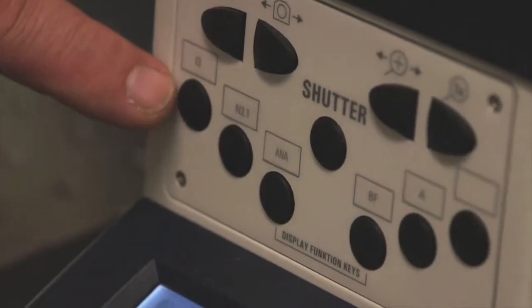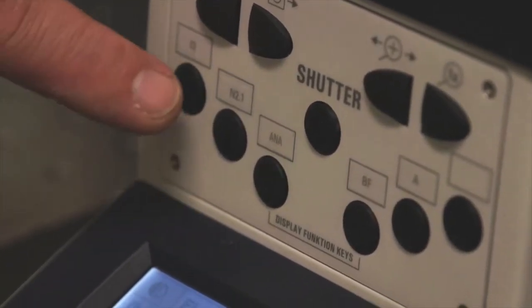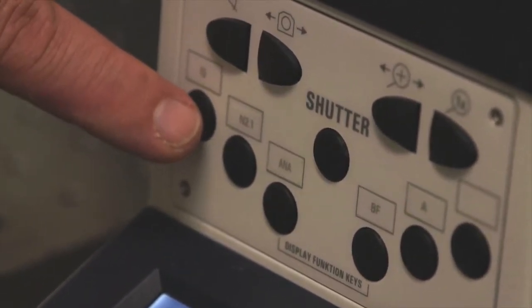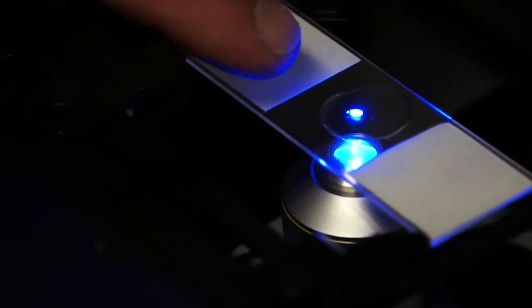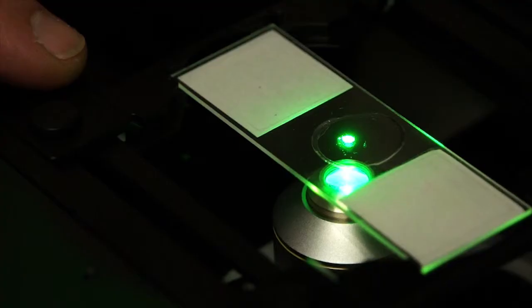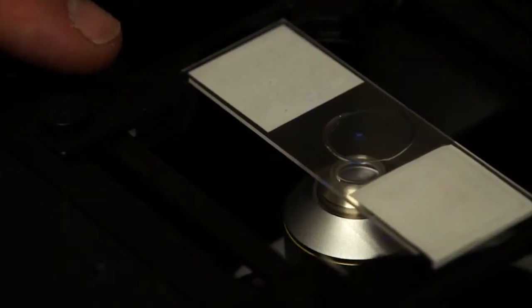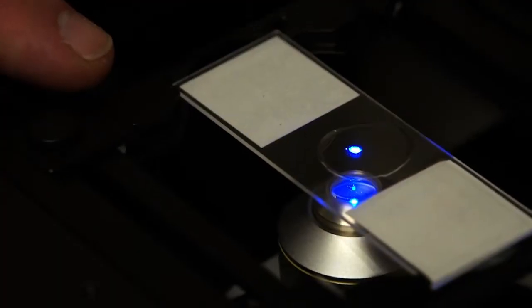To actuate the filter packs inside the microscope, you press the buttons on the front of the microscope, which allow you to select one of the four filter packages. This button is for FITC, this button is for Rhodamine, this button is for DAPI, and this button is for Green Fluorescent Protein.